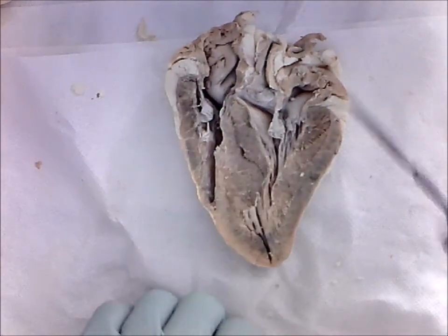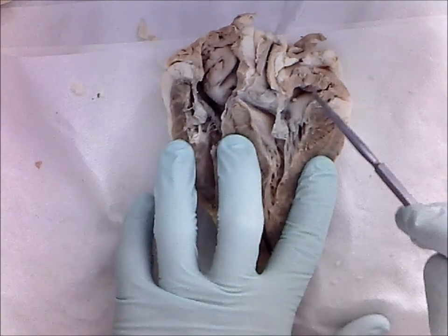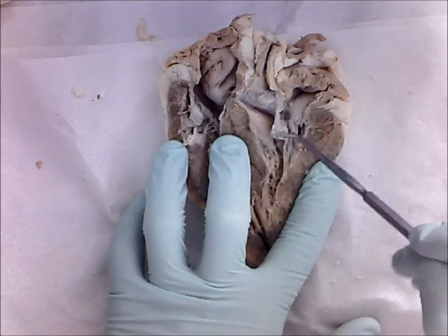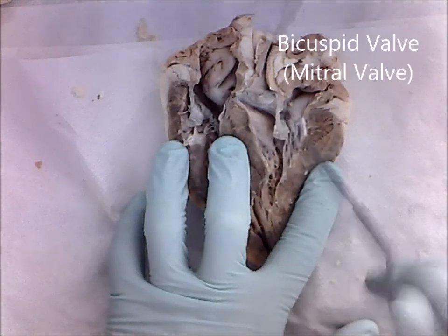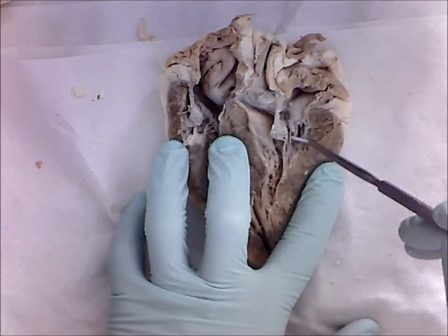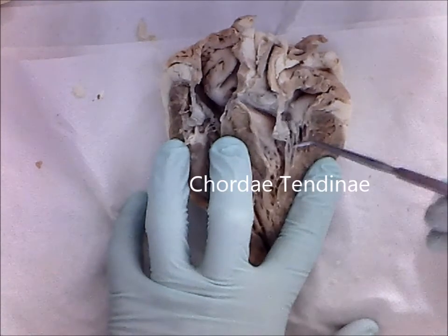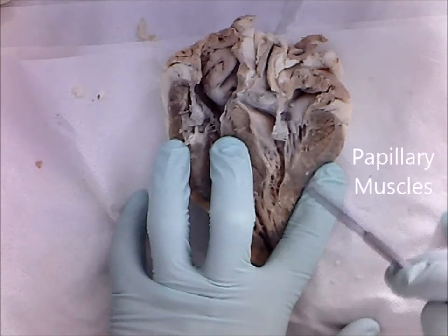Looking at the structures on the left side of the heart, we start with the left atrium. Blood in the left atrium is pumped through this valve. You can see the cusps of this valve. This valve is called the bicuspid valve or mitral valve. And again, just like the tricuspid valve, the bicuspid valve has chordae tendineae, and the chordae tendineae are attached to the inner walls through papillary muscles.